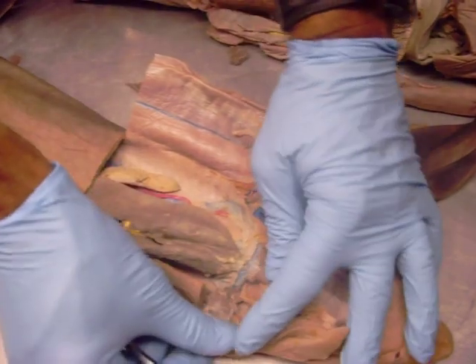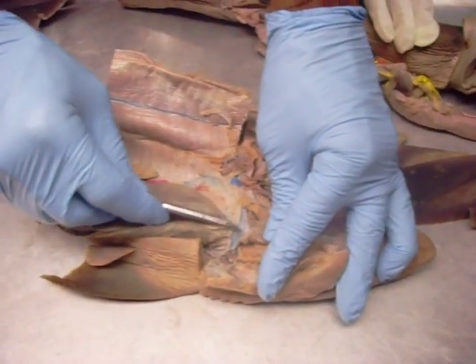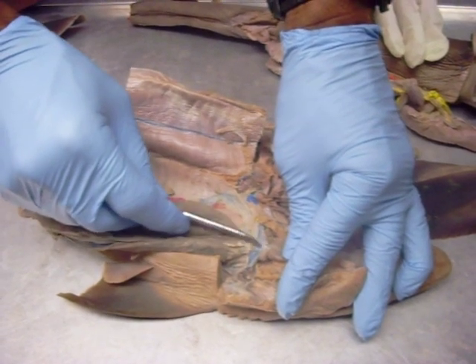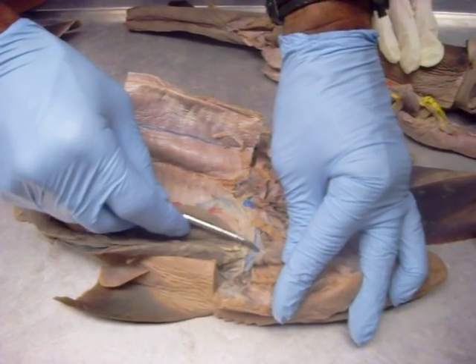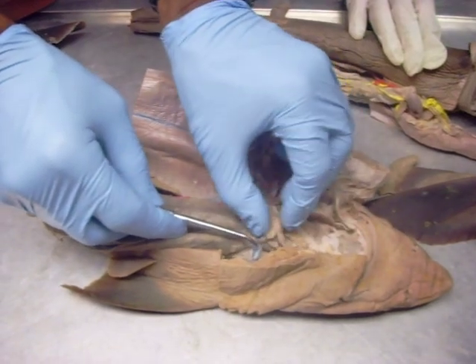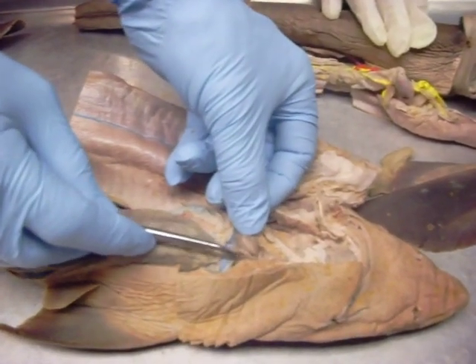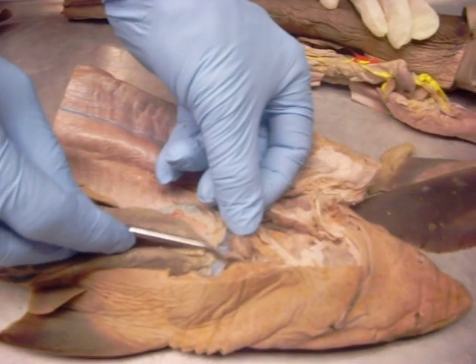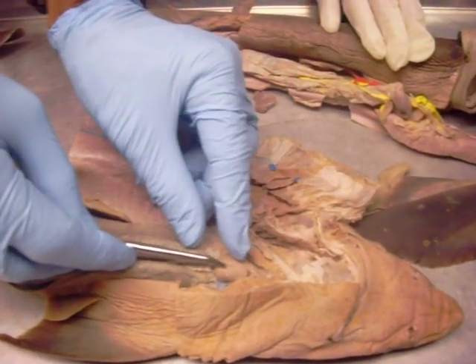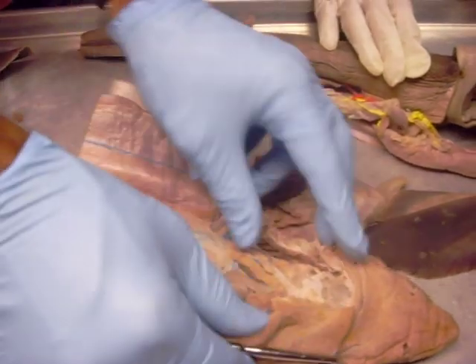I'll do it a second time. This right here is the sinus venosus, and these are the atrium. This is the atrium here. So that's the atrium there. This is the sinus venosus. This right here is the ventricle. This is the conus arteriosus.